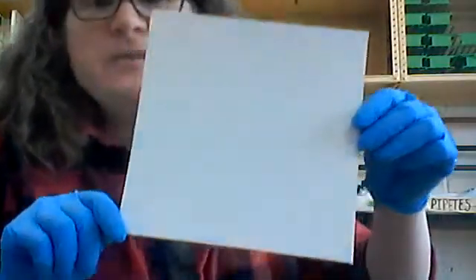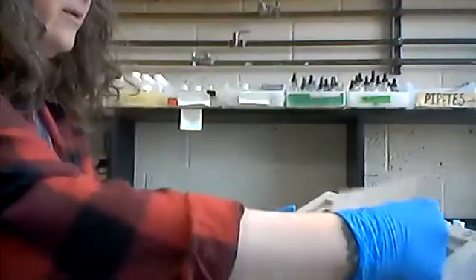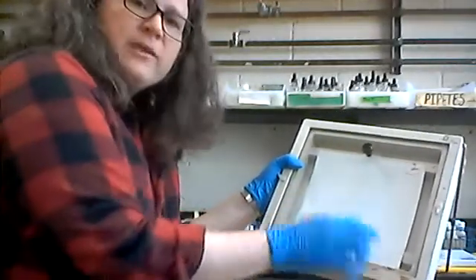I put about six or seven spots of each of the different amino acids. You can't really see them — they dry up pretty quickly on this paper. Now I'm going to take this sheet and put it into a chromatography chamber. I'll pour chromatography solvent in the bottom; it has a pad along the back that will help increase the amount of solvent contacting the sheet. I'll stick it in, put the cover on, and place the whole thing into a hood vent because it's really smelly. The solvent will run up the sheet and take the different amino acids with it to different levels depending on the molecules in the amino acid.